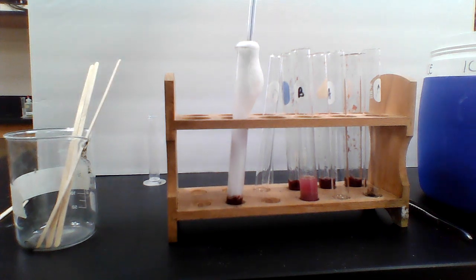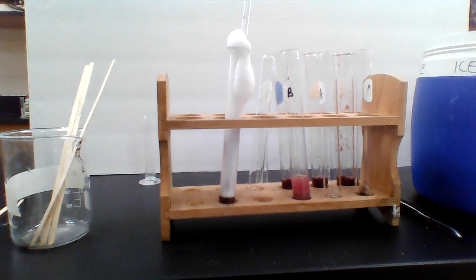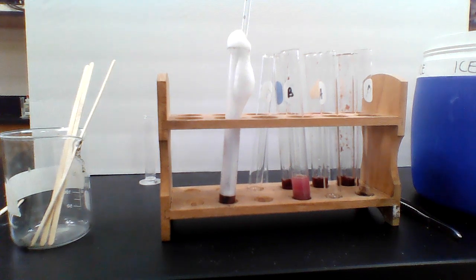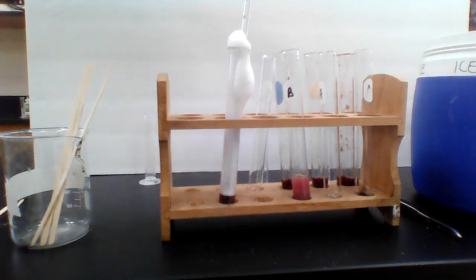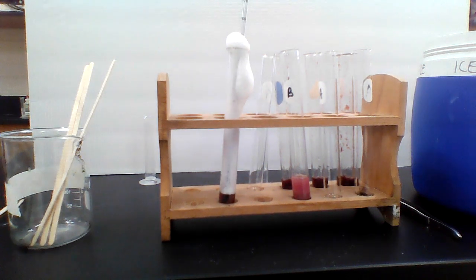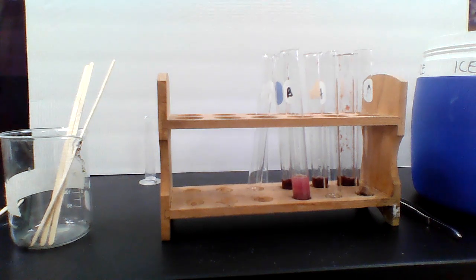And then let's go ahead and get a temperature change on this. Look at that disgusting mess. I'll give it a couple seconds for the temperature to rise up in the thermometer, and then I will tell you what the temperature reads. We'll give it just a moment more. And the temperature reads, not very high. It reads 30 degrees. So just all that foaming, and we only made it go up about 4 degrees. So 30 degrees for that temperature change. All right, we'll be done with this one. That was the whole liver.